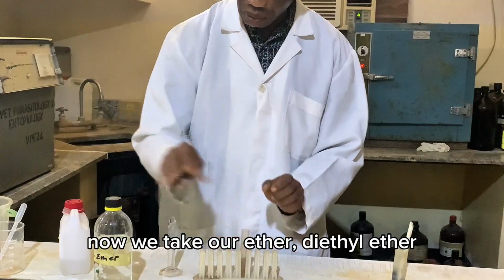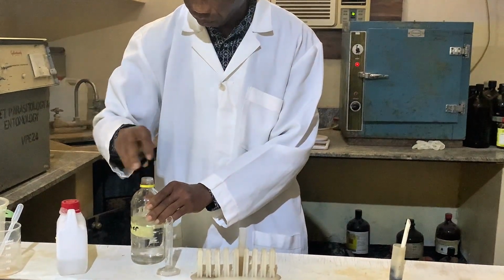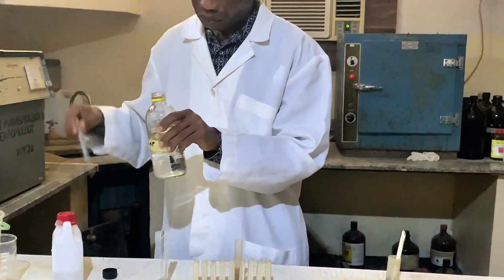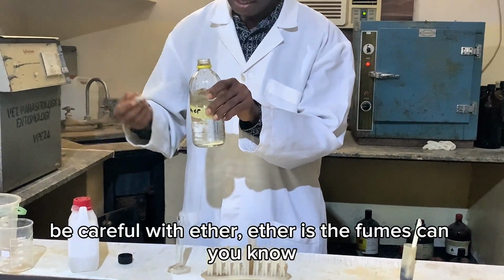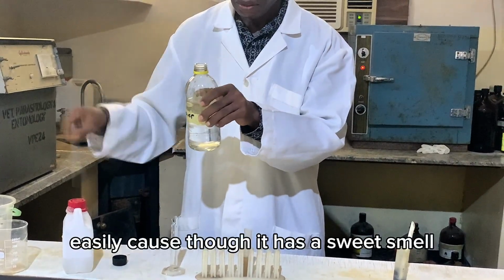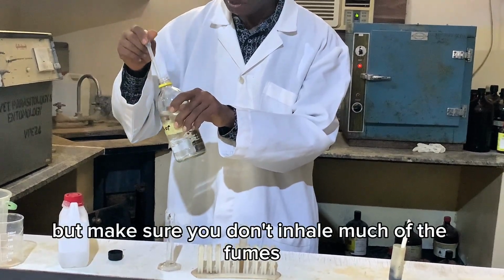Now we take our ether, diethyl ether. Be careful with ether. The fumes can easily cause problems; though it has a sweet smell, make sure you don't inhale much of the fumes.